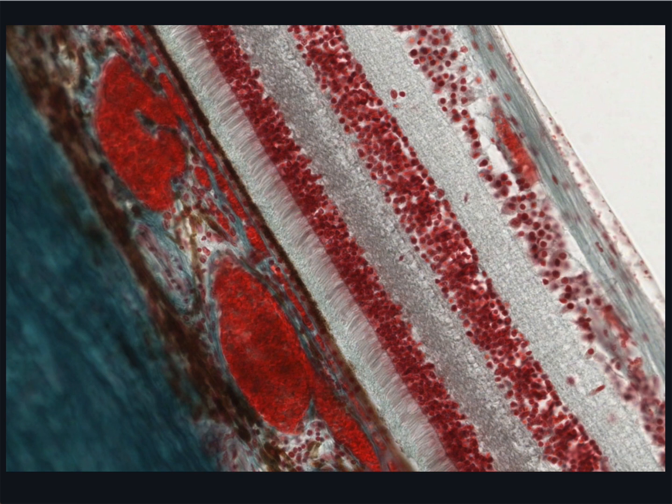The photoreceptors make synaptic contacts with bipolar cell processes and a class of interneurons called horizontal cells in this whitish layer adjacent to the nuclei of the photoreceptors. This layer is called the outer plexiform layer. The inner nuclear layer contains the cell bodies of bipolar cells, horizontal cells, and other interneurons called amacrine cells and glial or Muller cells. It's not possible to classify the cell types within the inner nuclear layer of this preparation.